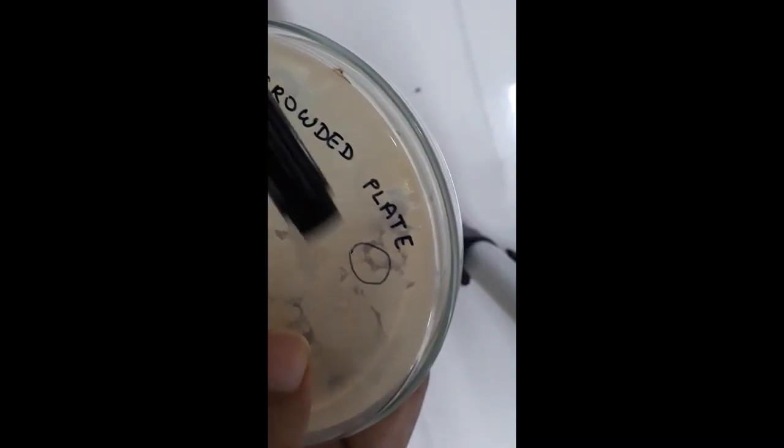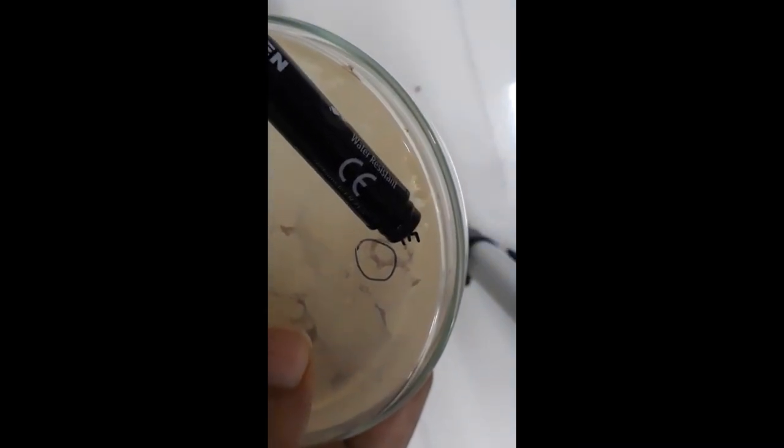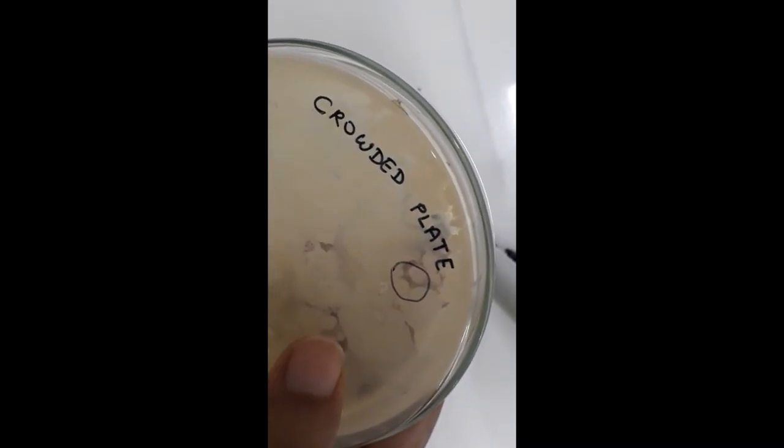So now what we can do is we can pick up this antibiotic producing colony and check for its antimicrobial activity using other test organisms.